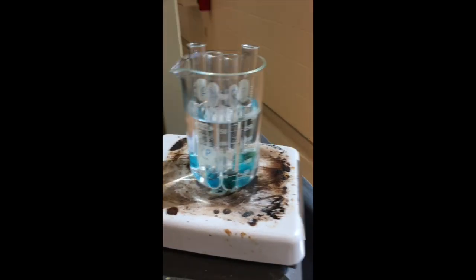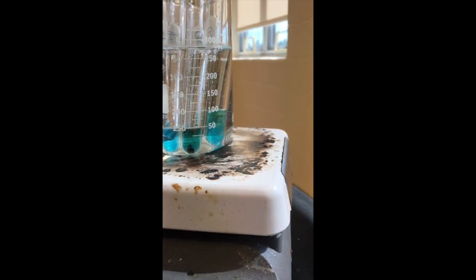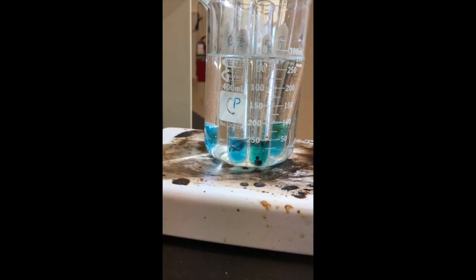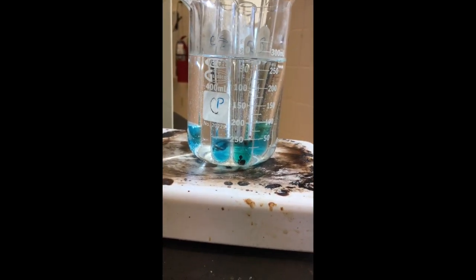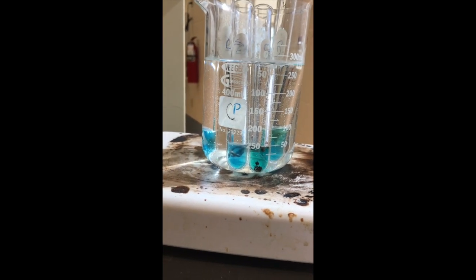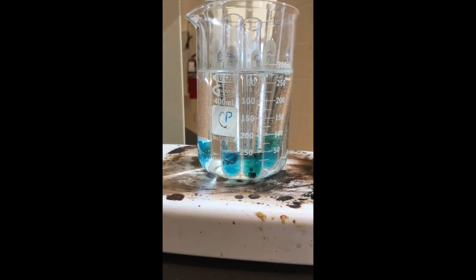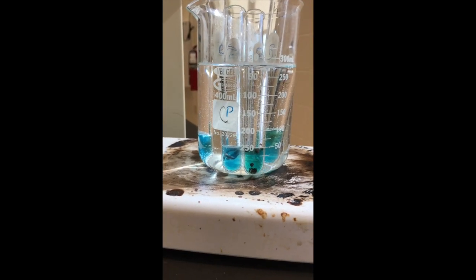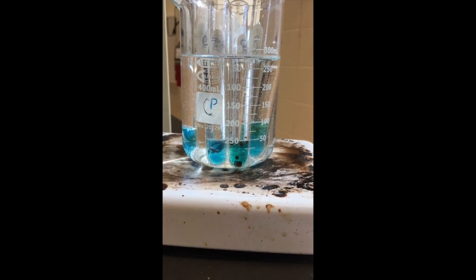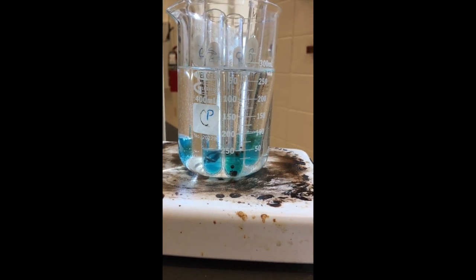Okay, here's our Benedicts. It's been a significant elapsed period of time. Please note, still we're looking at sky blue. Now, because these are all sky blue, that would indicate that indeed they do not have any simple sugars in them. But one possibility is that since the Benedict is already blue colored, the negative might be a false negative. What if the indicator chemical is no longer doing its job? What if it's no longer effective?